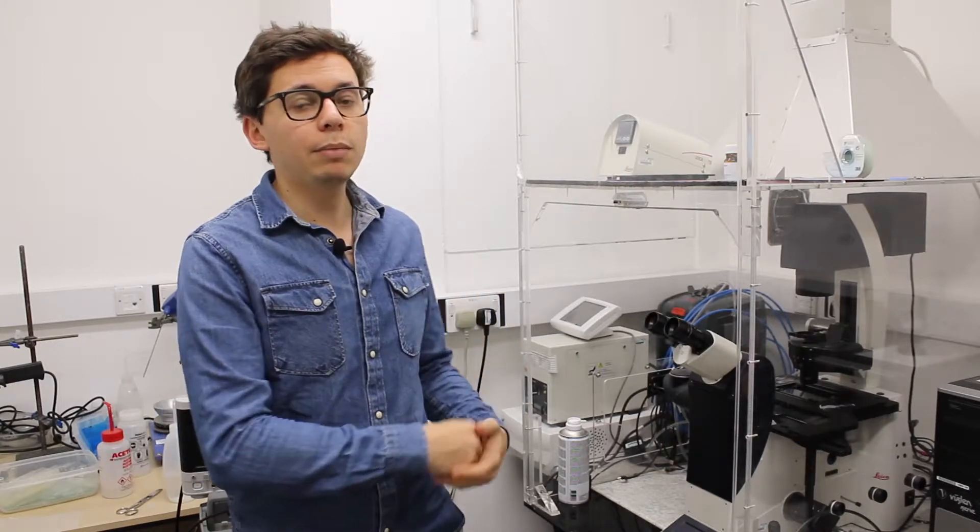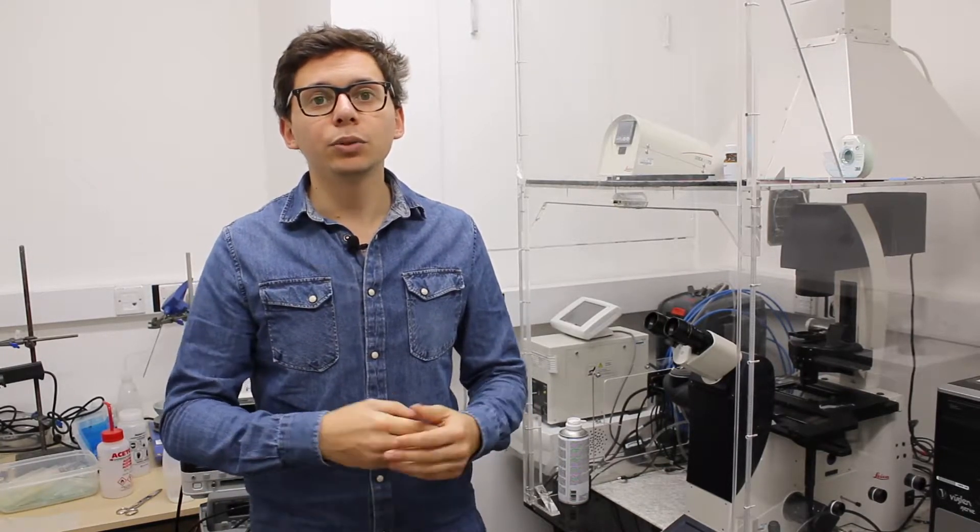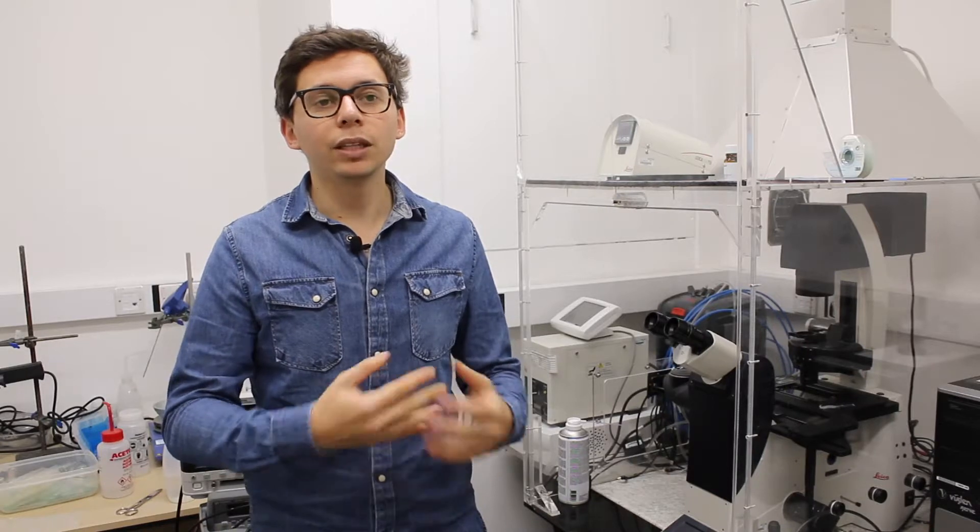Don't forget, when you're using the fluorescence lamp, to leave it on if someone else is using it after you, at least half an hour after you, because you will need to leave it off for at least half an hour before you can turn it on again to avoid damaging the lamp.